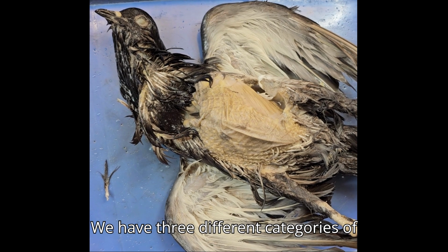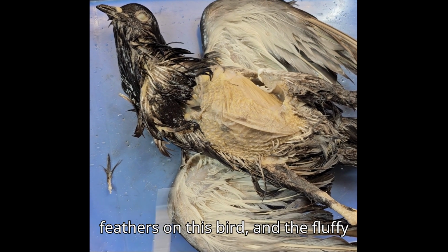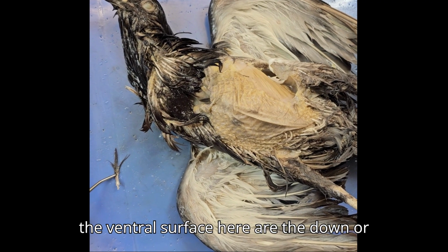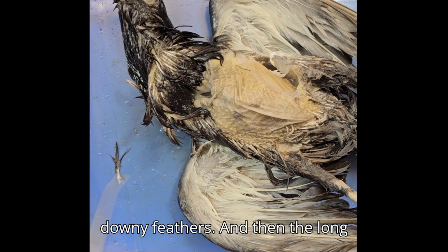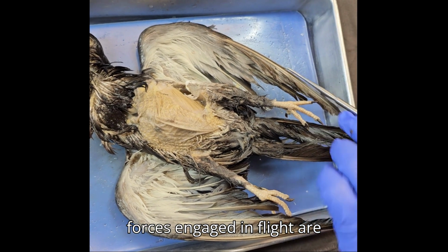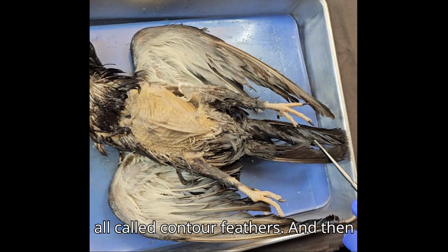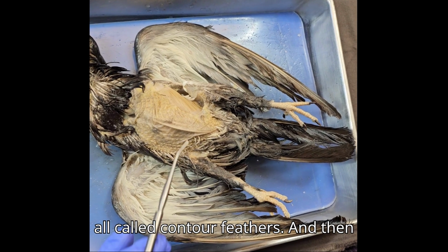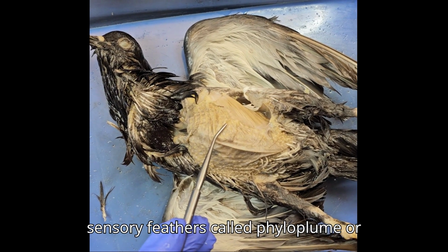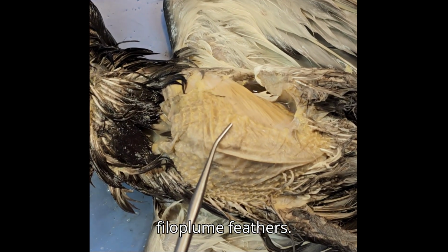We have three different categories of feathers on this bird. The fluffy feathers that I've removed mostly from the ventral surface here are the down or downy feathers. And then the long feathers that are responsible for the forces engaged in flight are all called contour feathers. And if you look real close, there are tiny little feathers right here. They're sensory feathers called filoplume feathers.